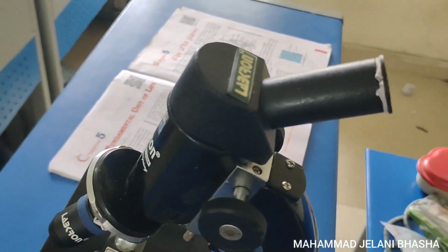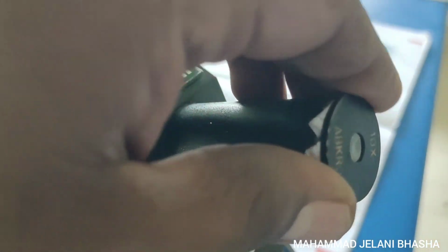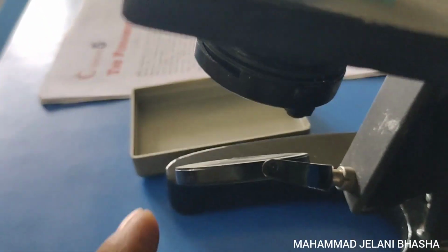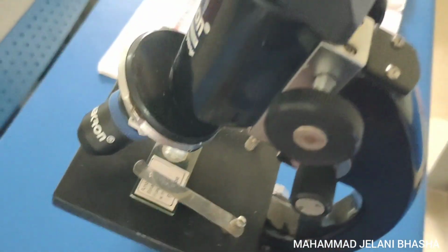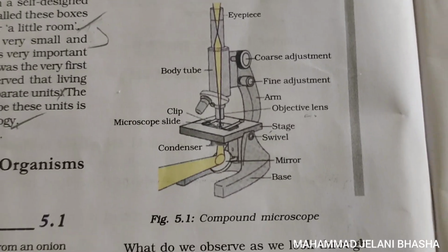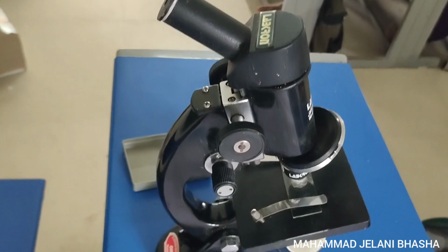Just see, this is the microscope, and today we are going to observe amoeba with the different parts of the microscope. This is the eyepiece and the objective, one of the most important parts, and the permanent slide here with amoeba above. And this is the stage, and this one is the mirror and the foot, and we have so many parts. Just see the diagram, the microscope diagram with the parts, present in the 9th class first lesson, and come to the other parts.